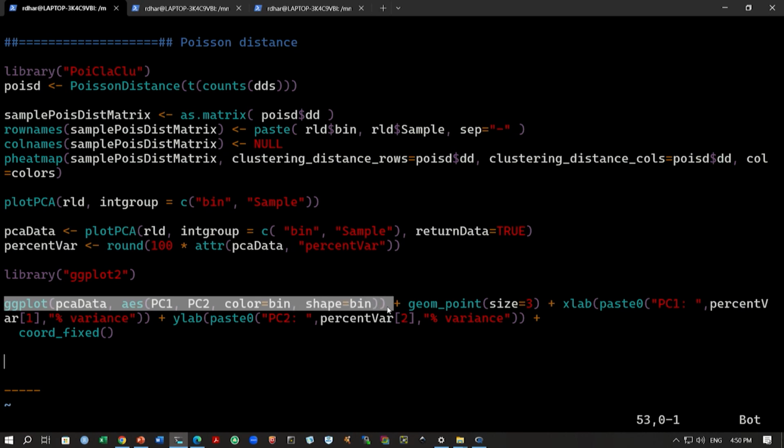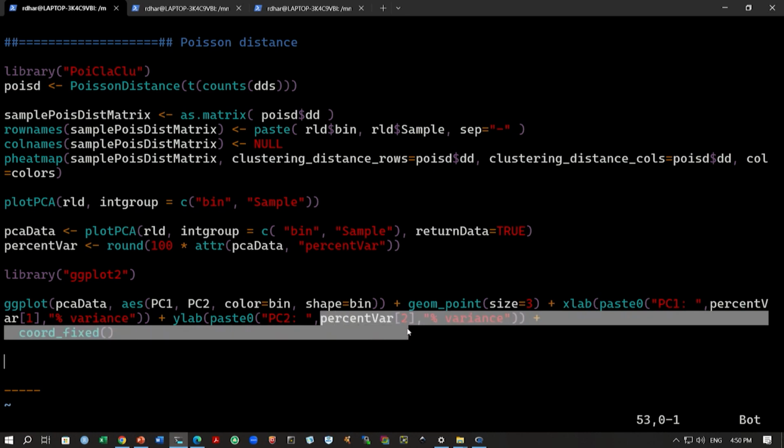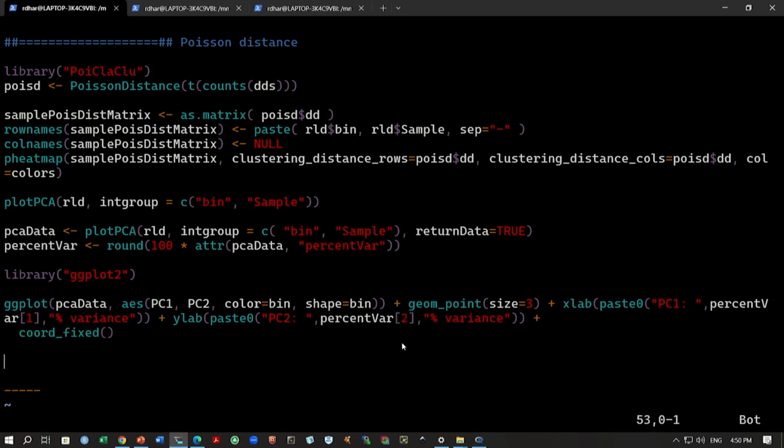Then you have this plus geom_point, the point size of these data points, then the xlab, the label of the x axis, and it should read PC1 percentVar[1], this comes from this variable percentVar. So, percentVar[1] means this is the variance explained by the first PC. Then similarly we have percentVar[2], this is the percentage of variance explained by PC2. So, these are simply referring to the x label and y label, the label of the axis, and then we have the coord_fixed.